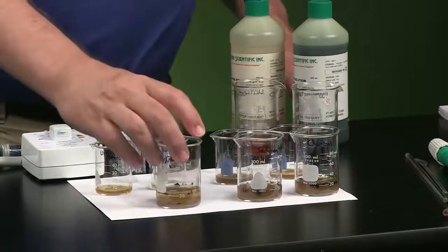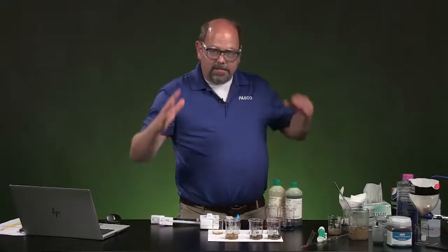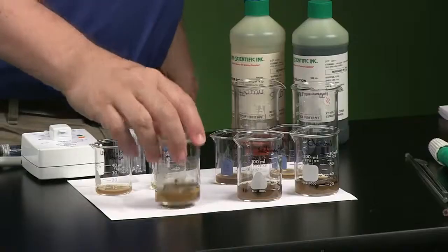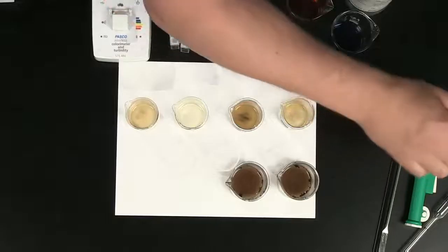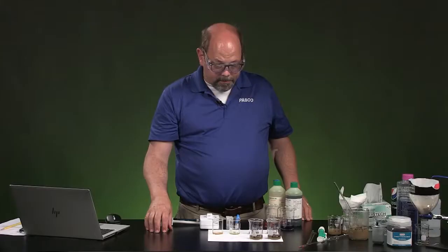And I'll set it down so you can look from above. There's sort of a white filmy look at the bottom that formed a cloud, and then those slowly fell to the bottom and brought particles with them. And you can see after it's been filtered, that did a really good job. Here, it's much lighter than this first one.